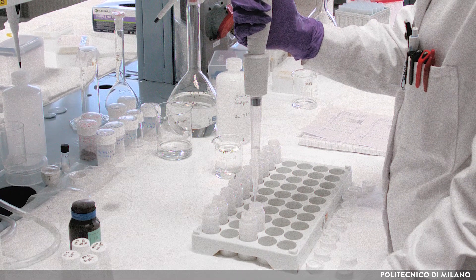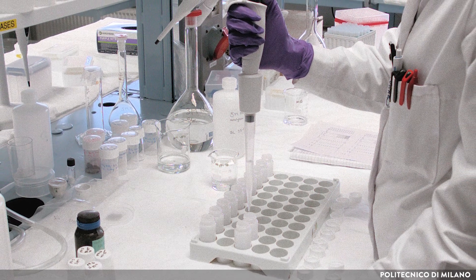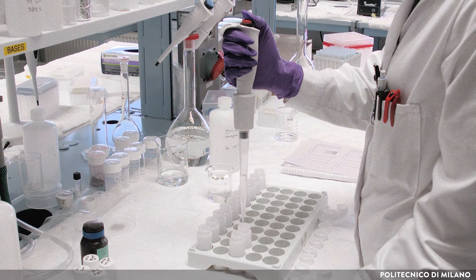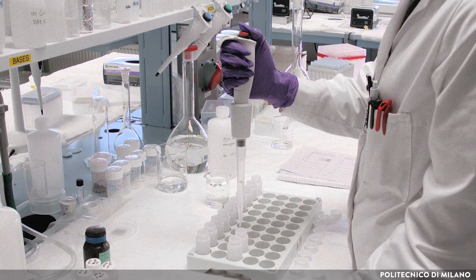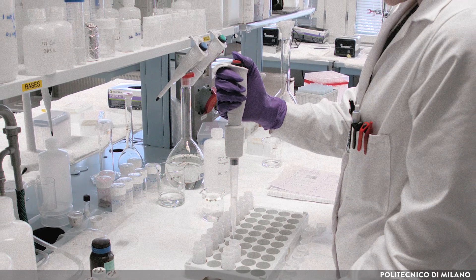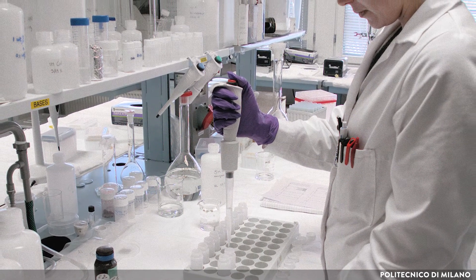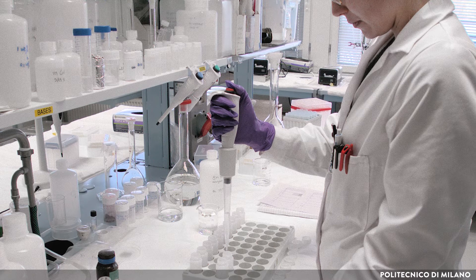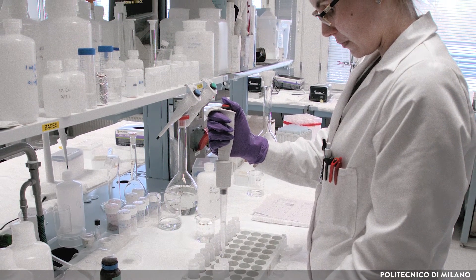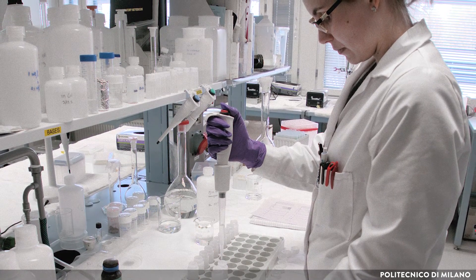Once the radioisotope is bound to an appropriate organic molecule to produce the radiopharmaceutical, further steps are necessary before it is administered to humans. The reaction mixture from radiosynthesis has impurities including side products, unreacted starting materials, and radio decomposition products. It is very important that the radiopharmaceutical is present in the intended form to avoid undesired effects when it is injected into the body.